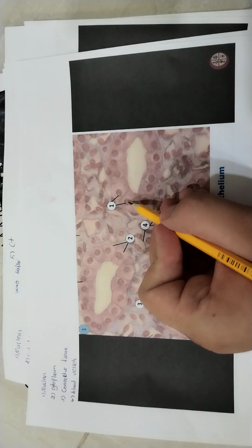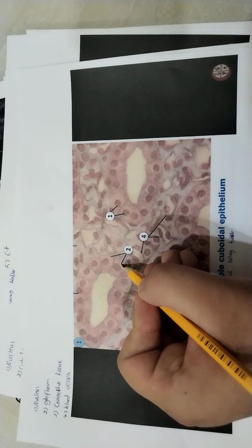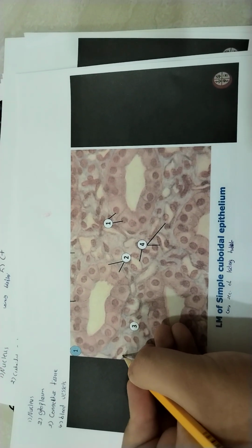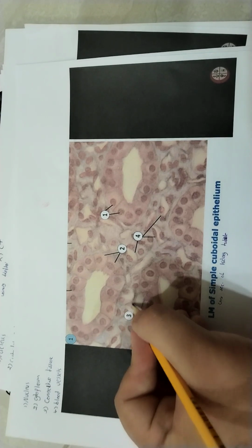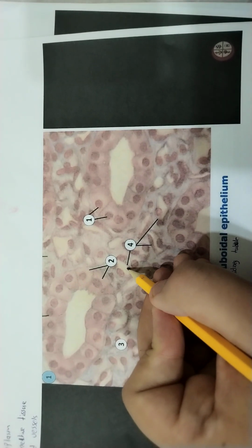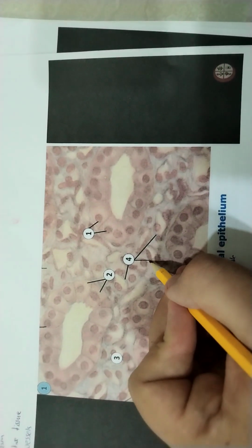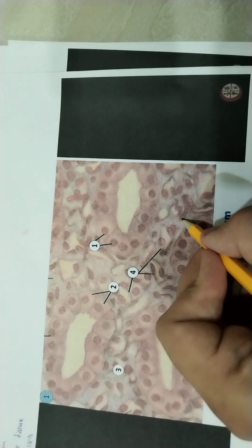Number 1, we have the nucleus. Number 2, we have the cytoplasm. Number 3, we have the connective tissue. How do we know it's connective tissue? We have extracellular matrix. Sorry, this is the connective tissue generally. It's important to know. Number 4, if we come here, we can see a little bit of red. Those are the blood vessels. This one appears very clear. It's a blood vessel. Here we have one.